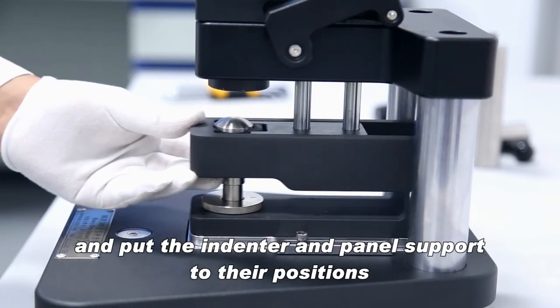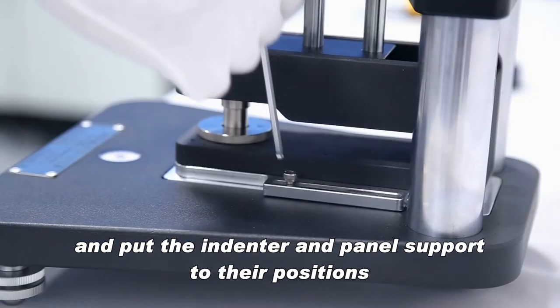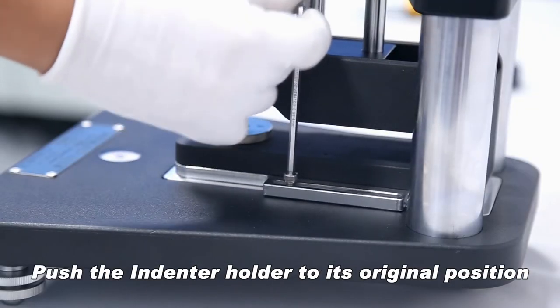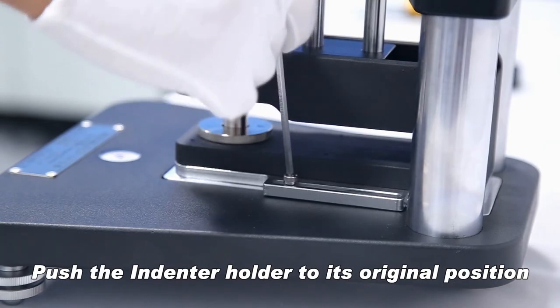Put the indenter and panel support to their position. Push the indenter holder to its original position.